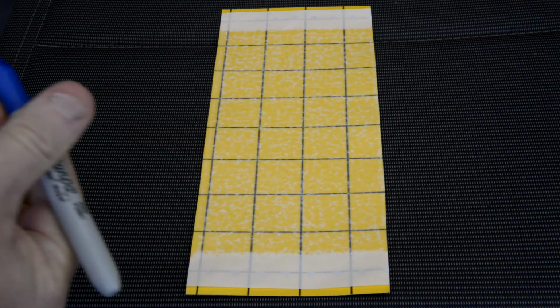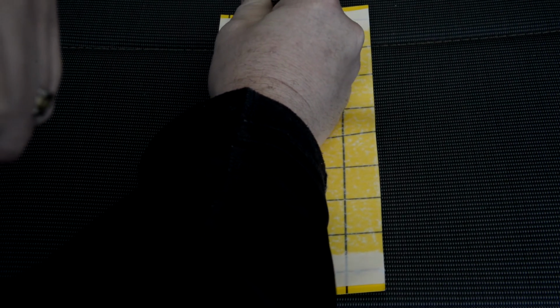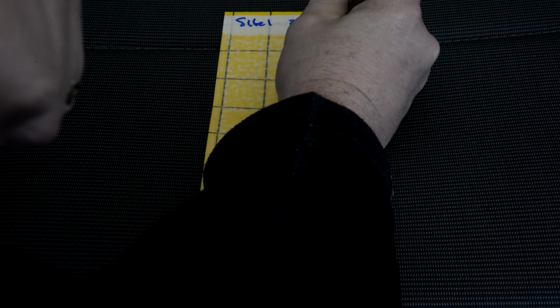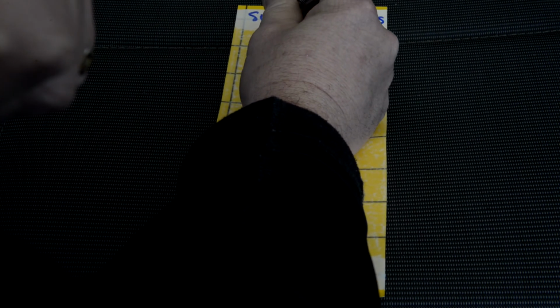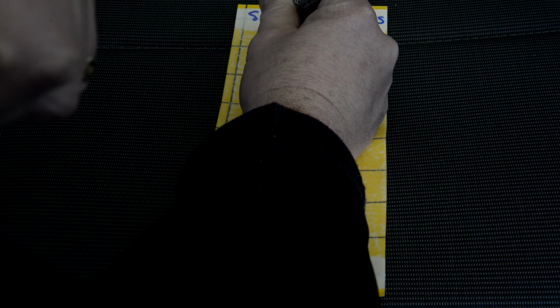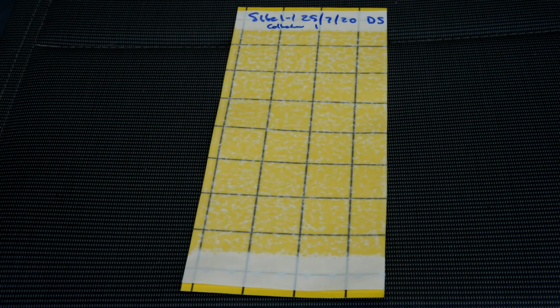So one thing to remember is every time you put a yellow sticky trap out into the field, you must correctly label that yellow sticky trap. This is essential as you will be actually IDing insects off this yellow sticky trap. It's very hard to get insects off. So the idea is that you'll be using a microscope or something to ID them on the card.